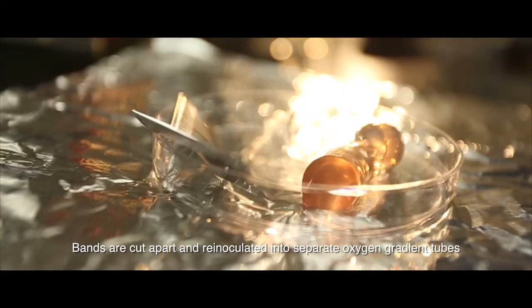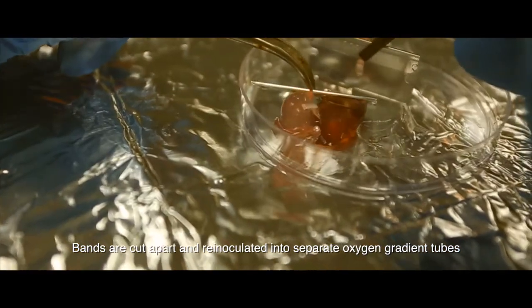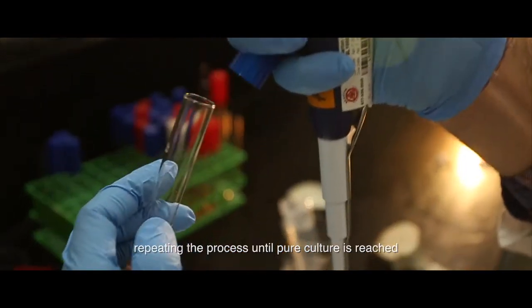Bands are cut apart and re-inoculated into separate oxygen gradient tubes, repeating the process until pure culture is reached.